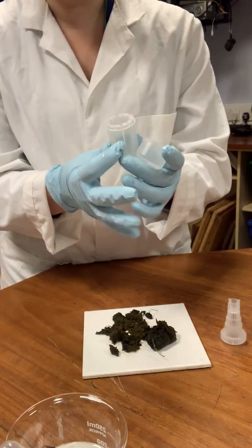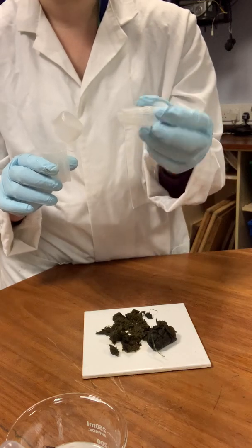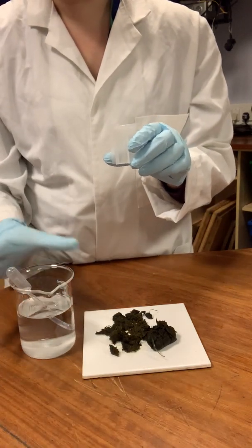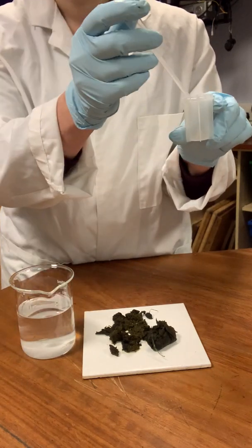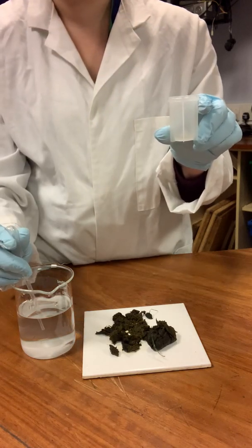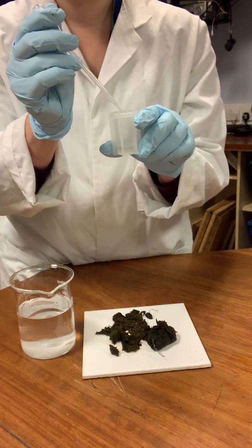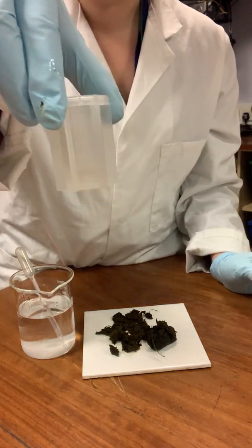So we've got our specimen tube here, and we've got the second part of our specimen tube, which is actually going to collect and mix our sample together. So what we want to do to start with is we're just going to use our solution. We'll pop in the notes what the solution actually is for you, but we just want to fill a little bit of solution into the bottom of the tube. So about a quarter full, just to get us started, as you can see there. Let me get my hands out of the way for you.